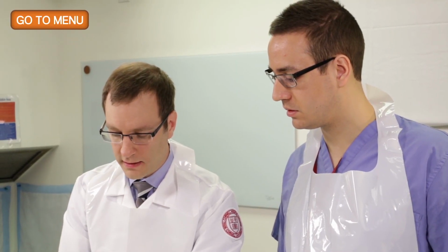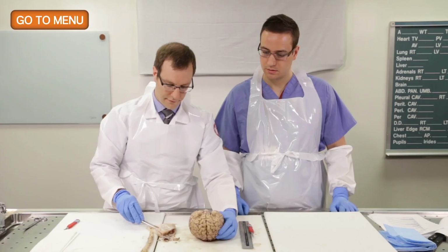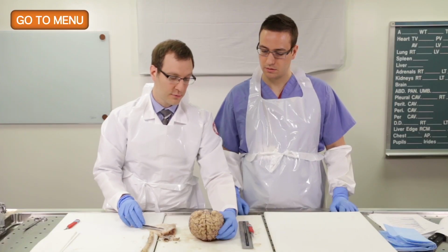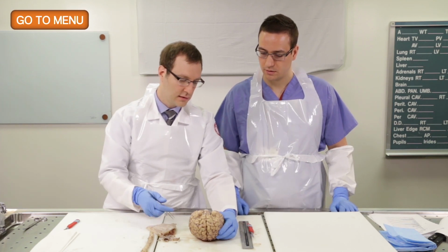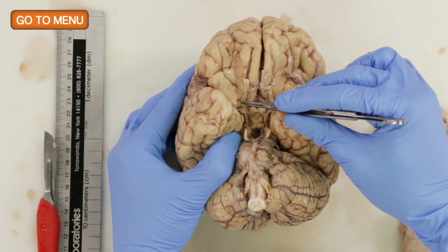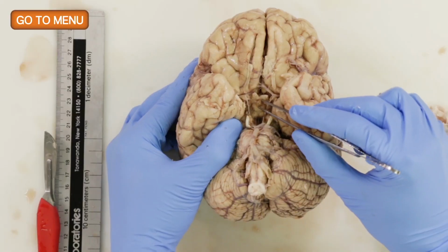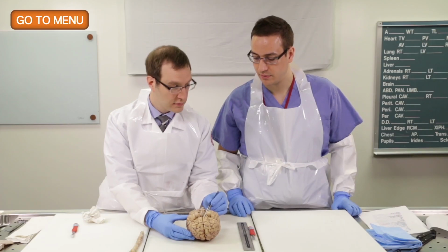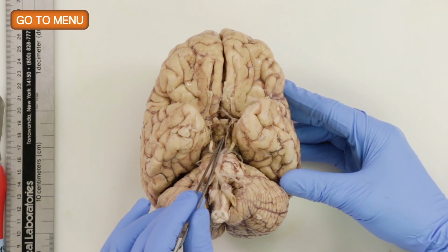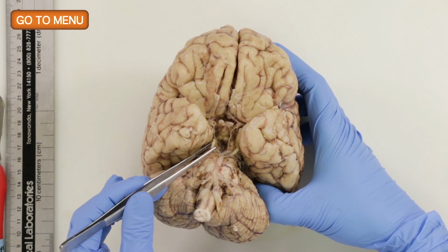The other thing you want to take a quick look at are the cranial nerves, okay? So oftentimes, if there's a cranial nerve defect, we'll have some clinical evidence of that, but we do routinely take a look at them. So here's the olfactory, right? What would this be here, Cliff? That looks like the optic nerve. Right, that's the optic nerve. And what is this structure? Looks like the stalk of the pituitary. That's right, that's the pituitary stalk. Then posterior to that, we have our mammillary bodies. And then which nerve would this be?